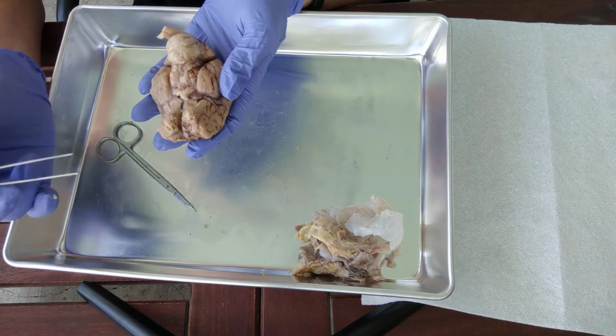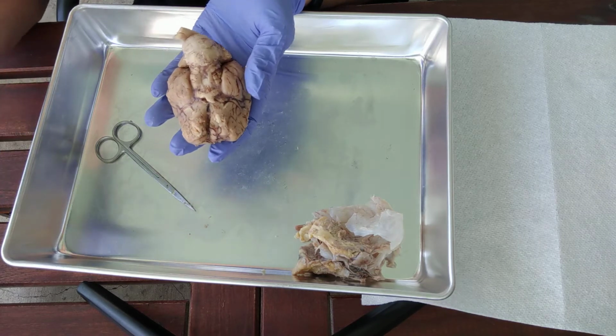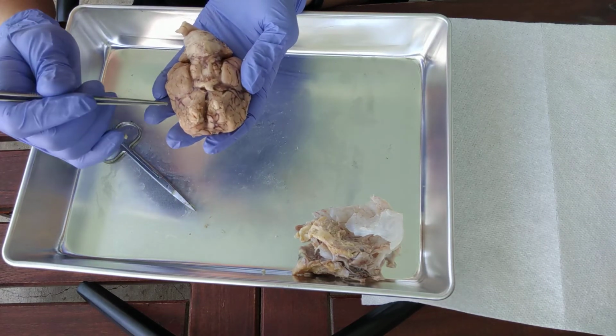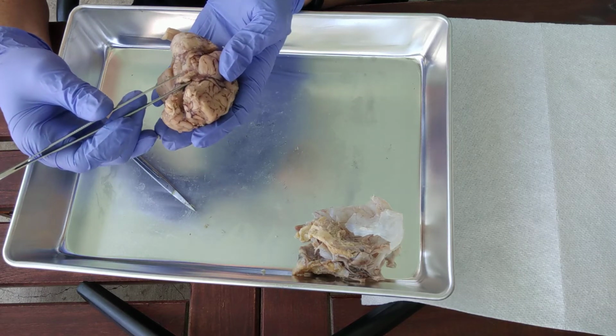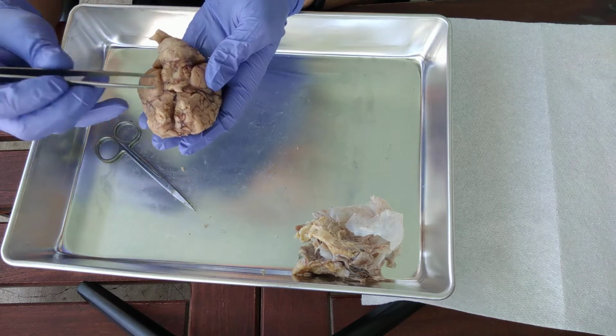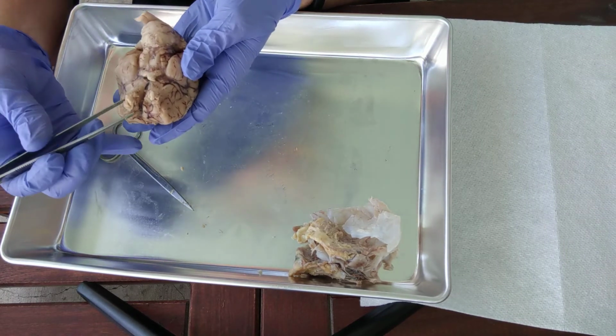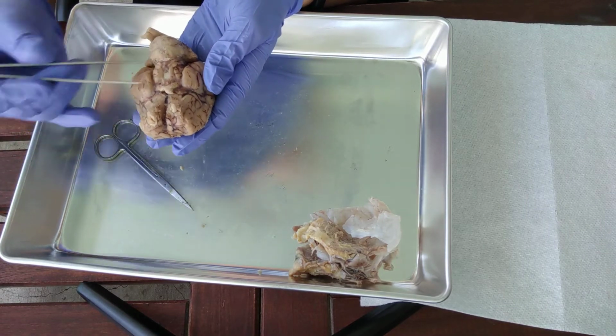Okay, so notice that a tract means that it is a white matter tract, which means it is part of the central nervous system, so part of the brain itself. And it's different from a nerve because nerves would be part of the peripheral nervous system. Okay, so this is the olfactory bulb, olfactory tract, going kind of posteriorly.